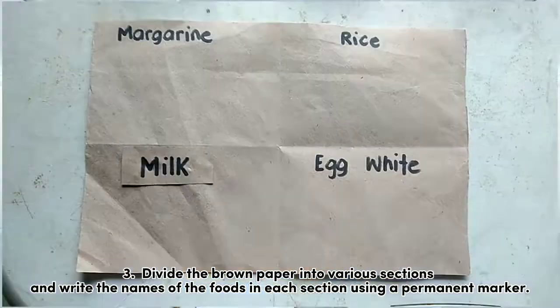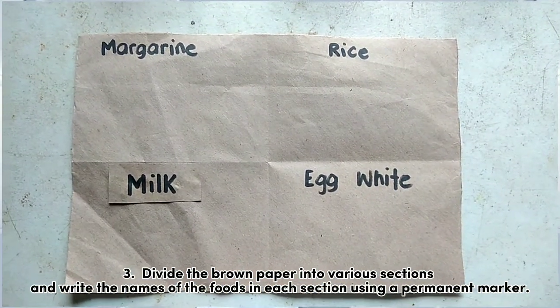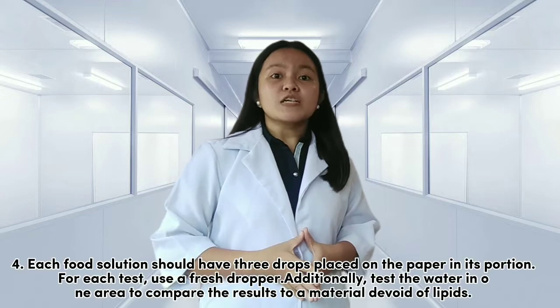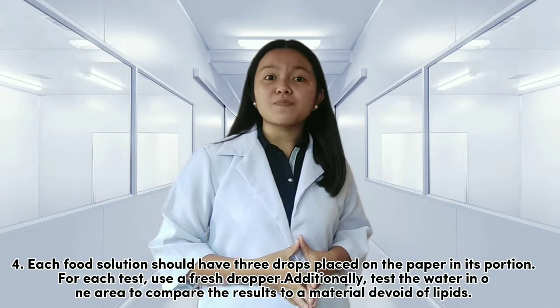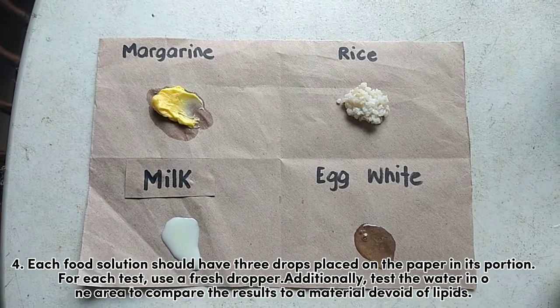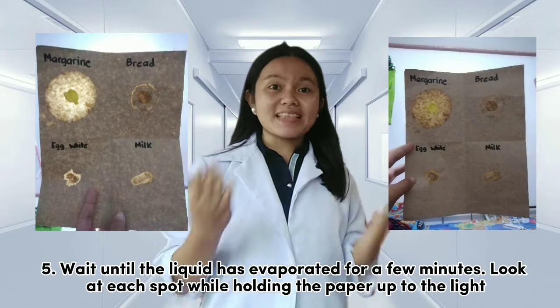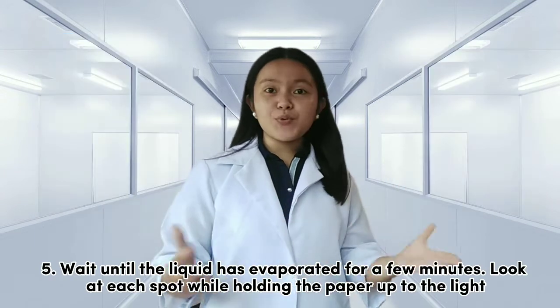Divide the brown paper bag into various sections and write the names of the foods in each section using a permanent marker. Each food solution should have at least 3 drops placed on the paper, each portion. For each test, use a fresh dropper, but I use syringe in my case because I don't have a dropper in my home. Lastly, wait until the liquid has evaporated for a few minutes.